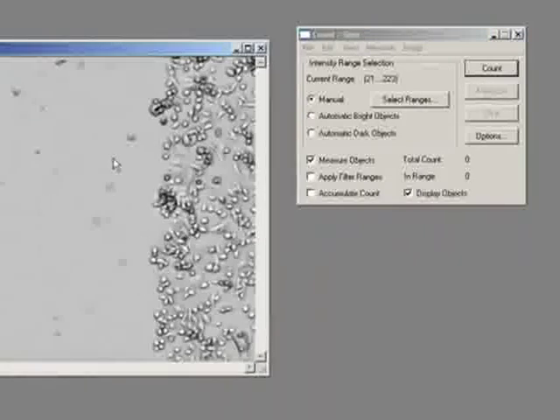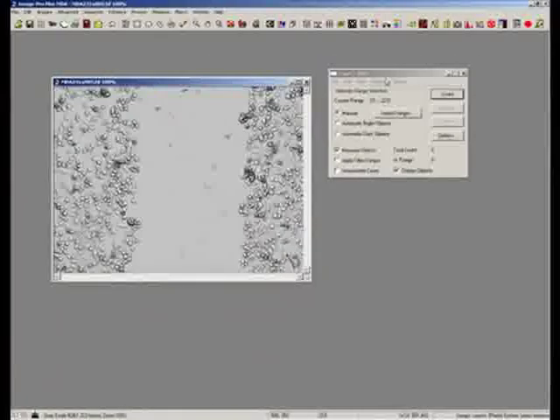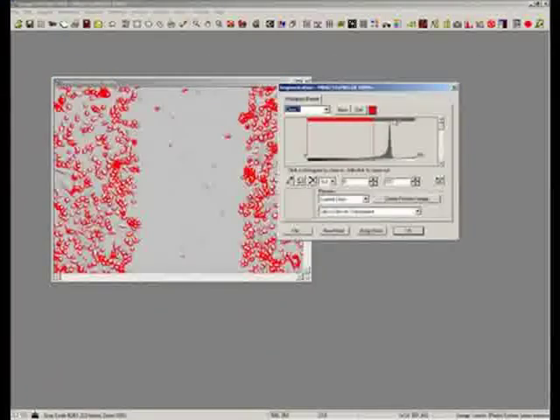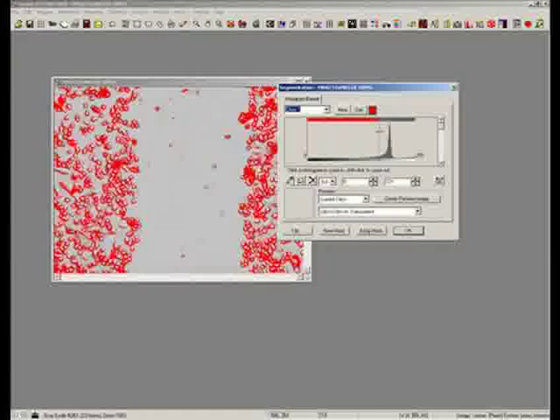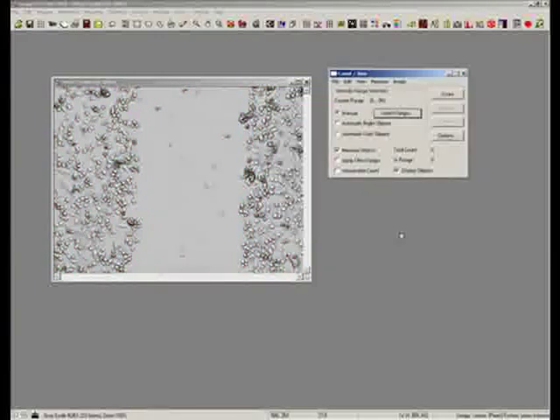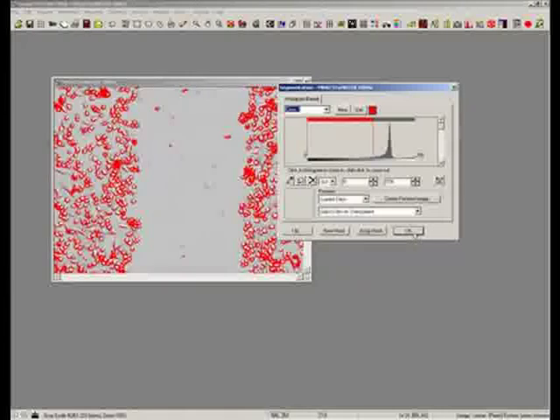So now, ideally what we want to have is a binary image. We want to have cells, white gap, cells. So if we try to do a threshold on this, we have the problem that we can't segment out our wound in the middle because the phase effect doesn't allow us to do that. We still have the holes inside our objects at the same grayscale value as the center.